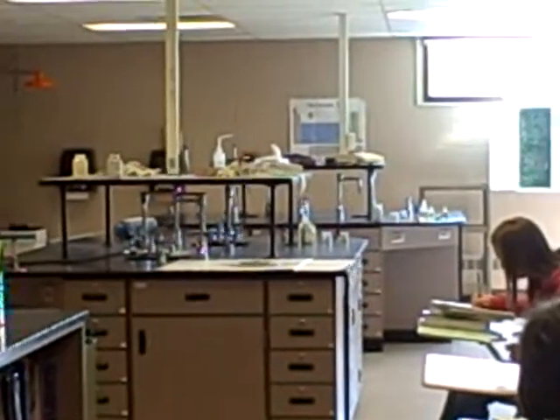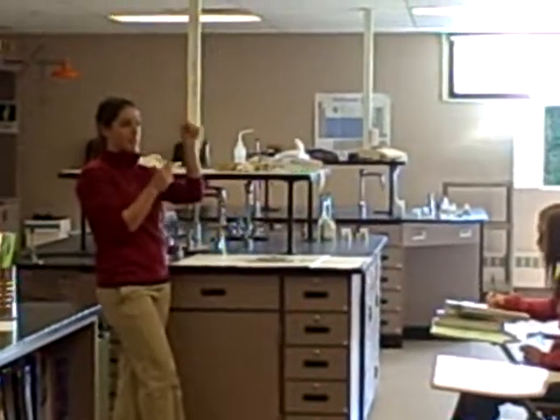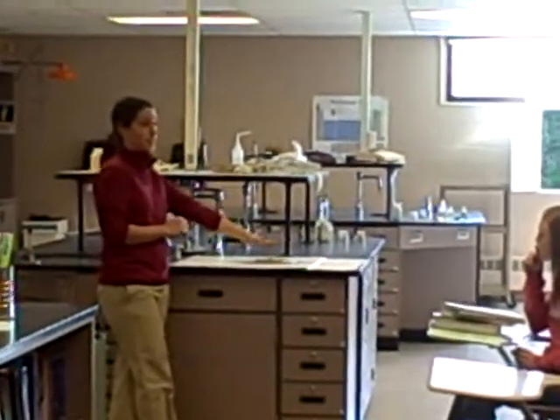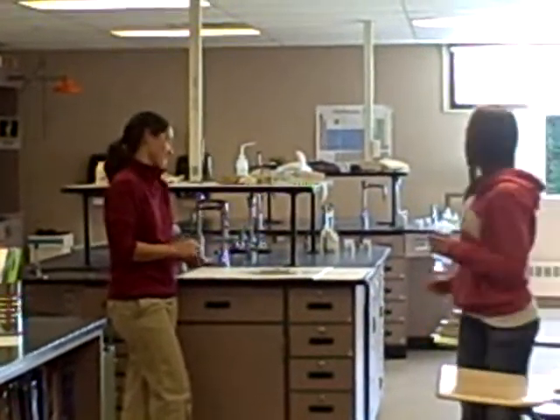Okay. So, little pile on the plate. What I have here is magnesium. This is just the wick. This is not the reaction. This is just so I can light this without being right next to it while it happens. Which means I'm going to ask you three to stand up and move. It's not that hard, but trust me, you're not going to want to be next to it. You can just go back there.